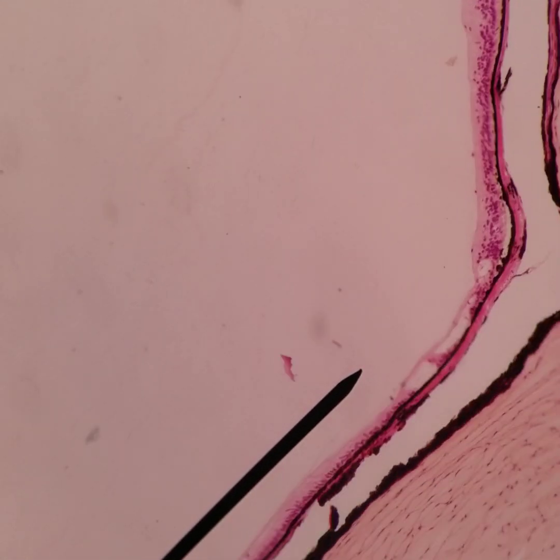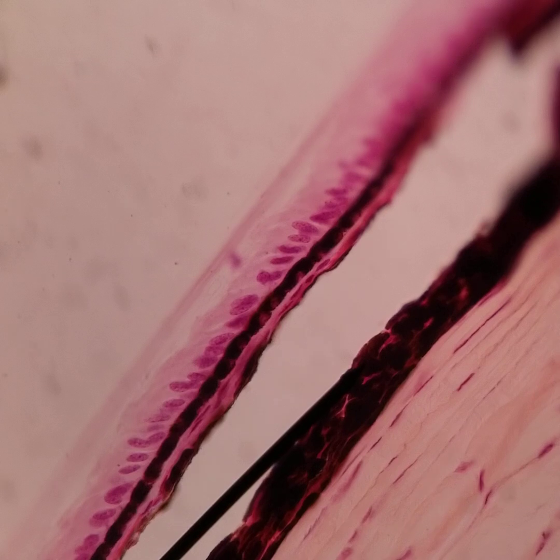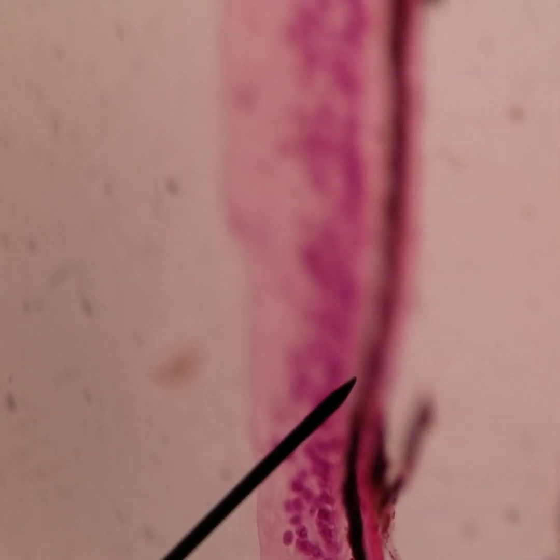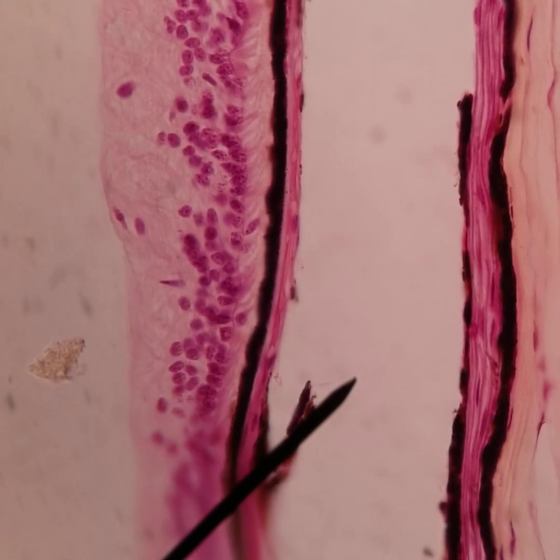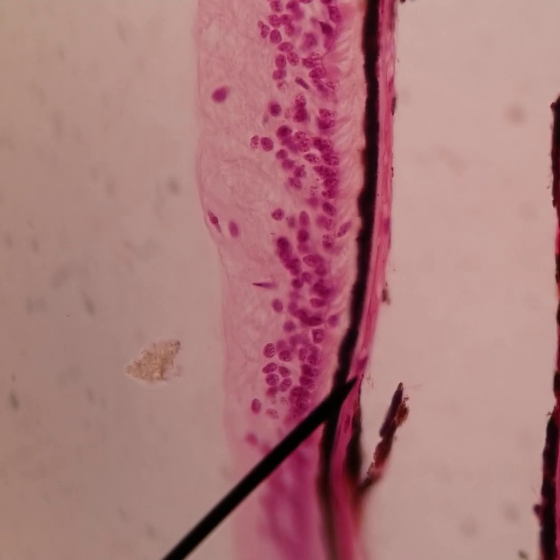The non-pigmented ciliary epithelium as it moves posteriorly transitions into neural retina — you can start to see those nerve fibers appear. This transition isn't the clearest here, but you can see those retinal layers, and then the RPE just past that.